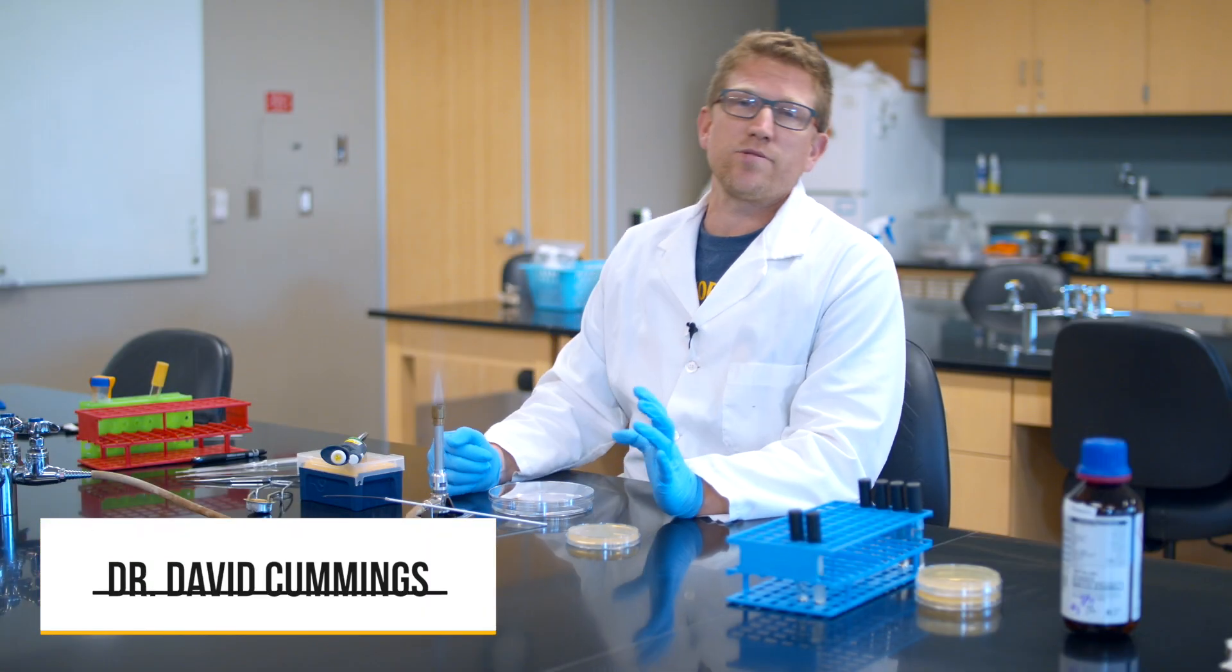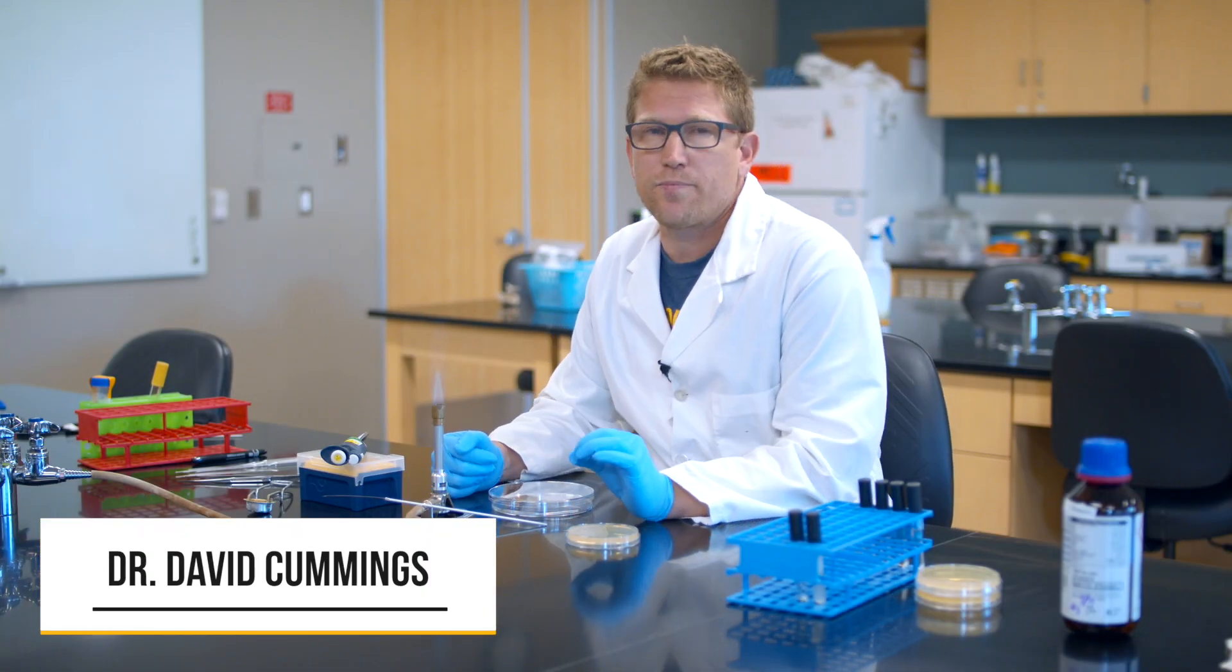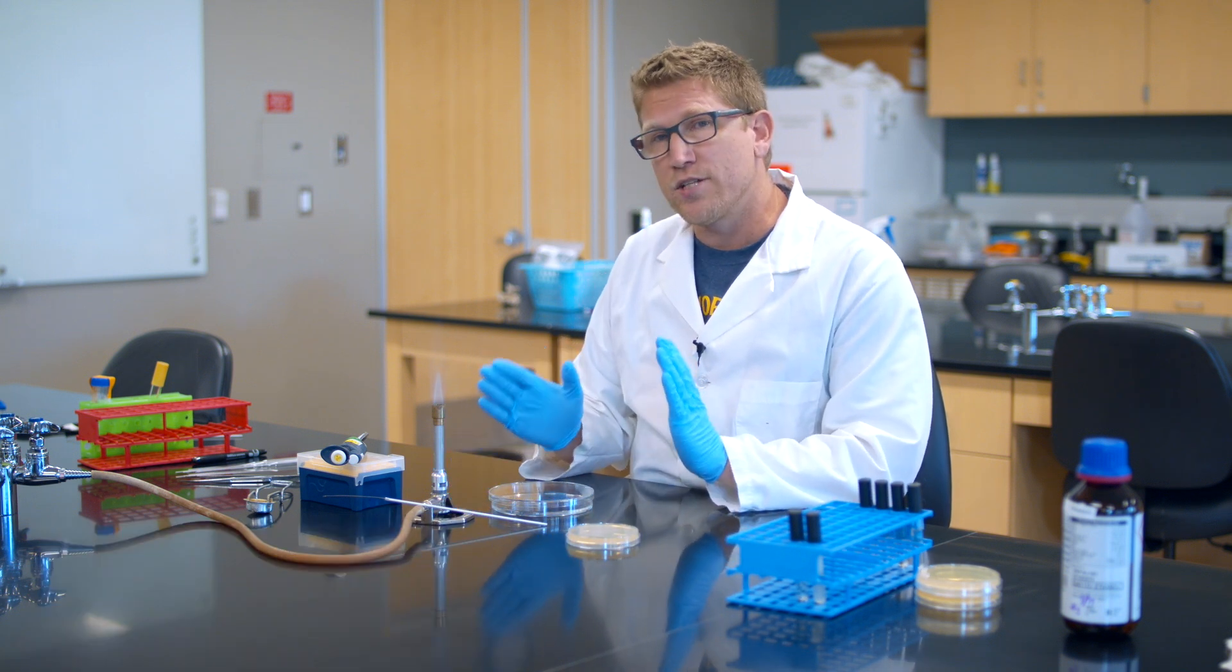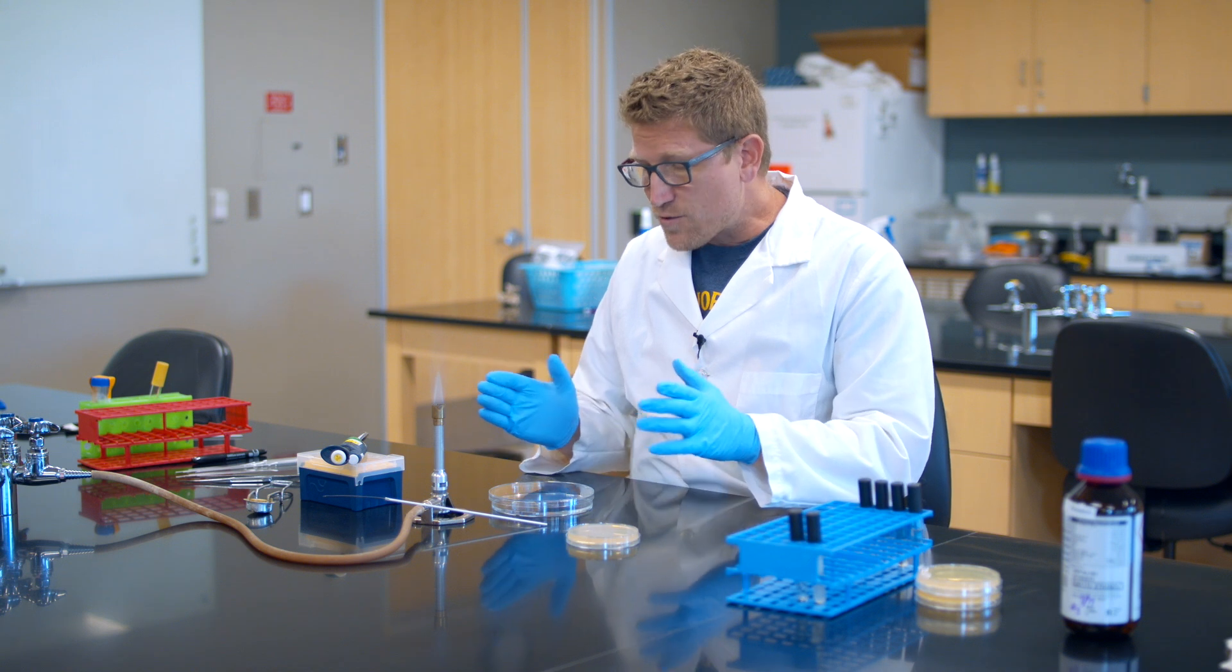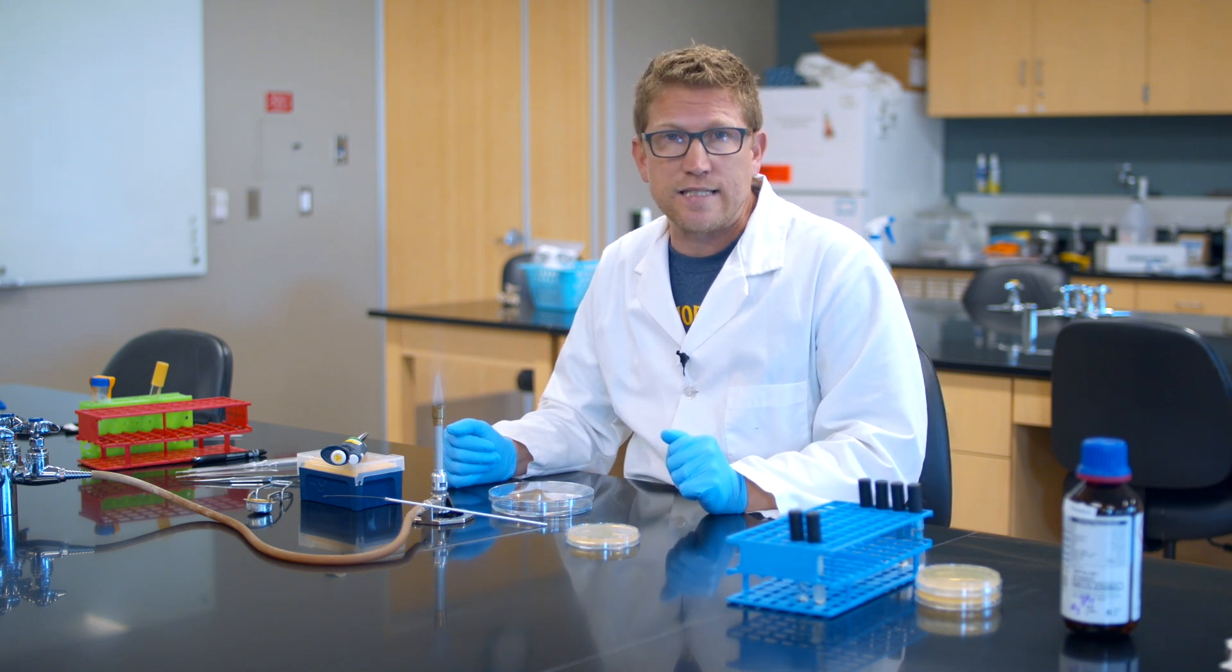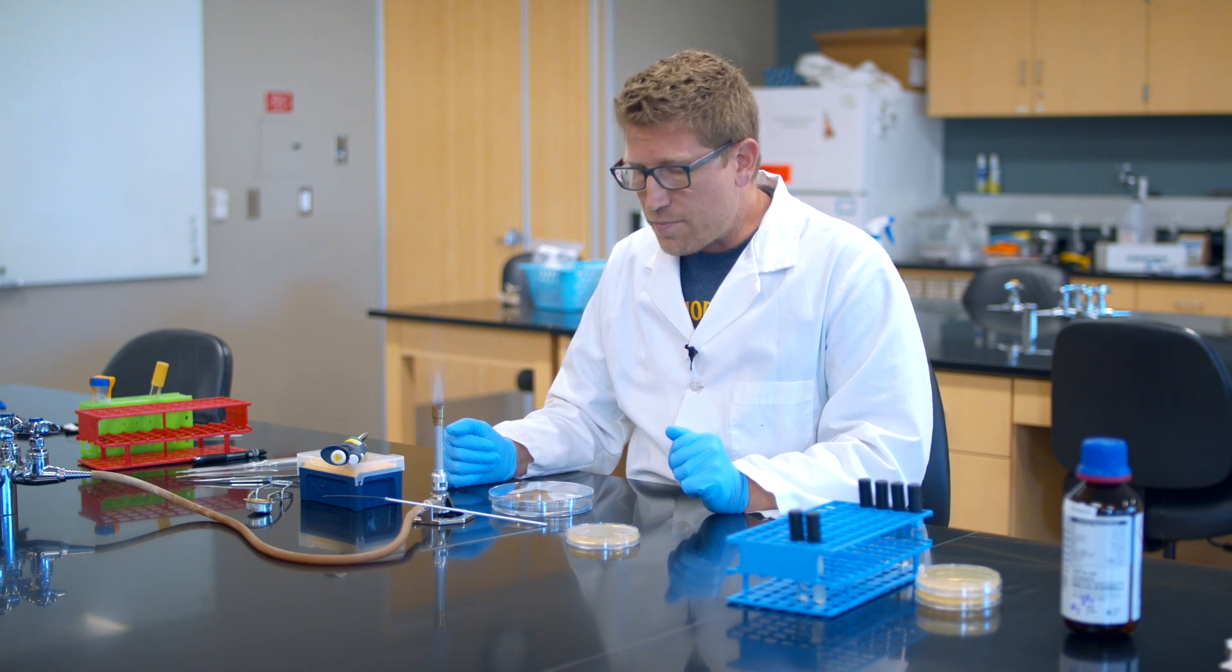Hey guys, in this video what I want to teach you is how to make a spread plate. A spread plate is distinct from a streak plate in that we're not trying for individual colonies. In fact, what we're trying to do is spread out all the bacteria as evenly as possible across the entire surface of the petri dish.